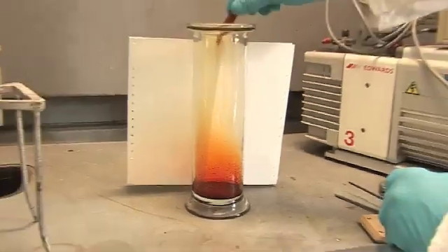It's this beautiful red colour, and it has an unpleasant smell. Bromine comes from the Greek word 'bromos', which means a stench — a really horrible smell.